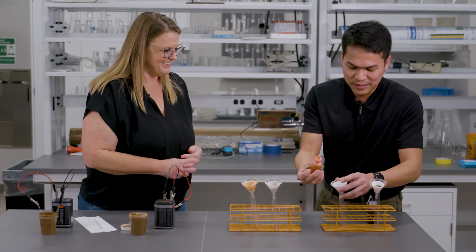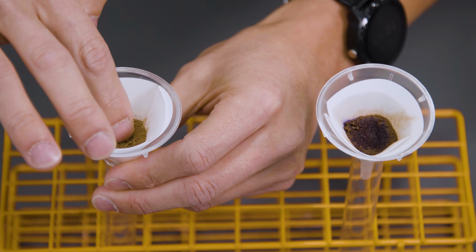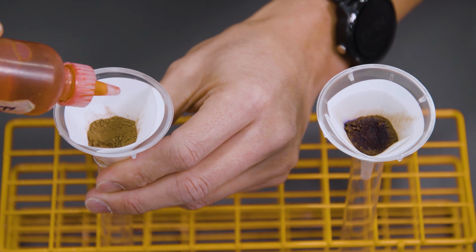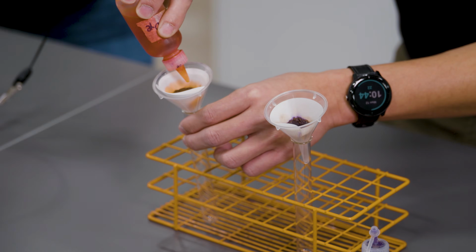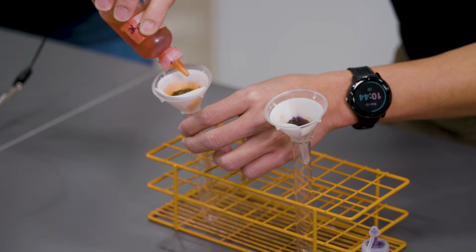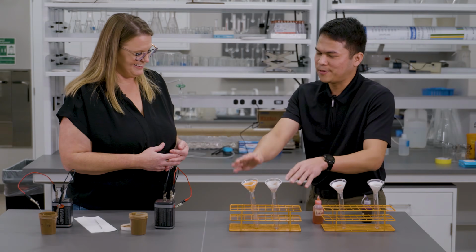For now, make a depression, add this one drop by drop, making sure that the drops hit the soil, not the filter paper, just like what we did in the previous one. And you're not adding any water or anything to this? Nope, we're not adding any water, Casey. You've got to add enough drops to actually get some of it. And again, this one takes time. That's why I prepared another setup for you.